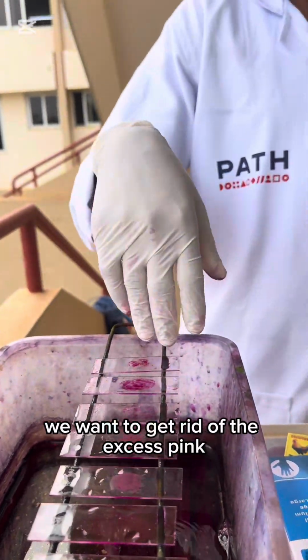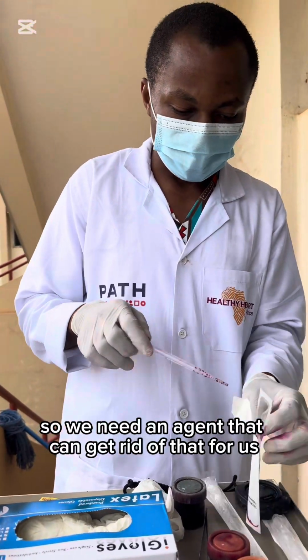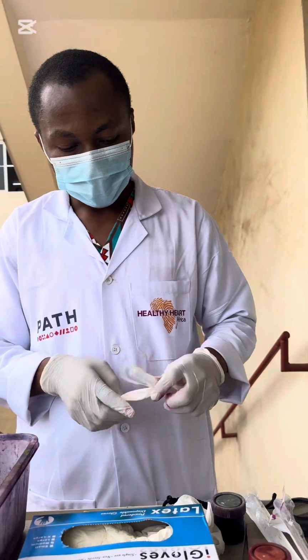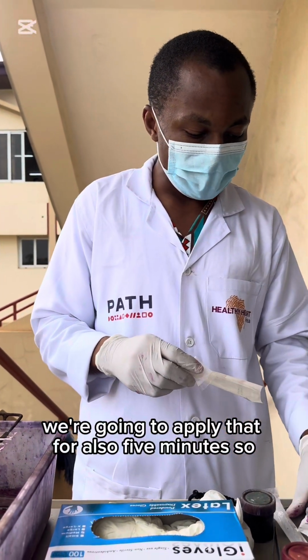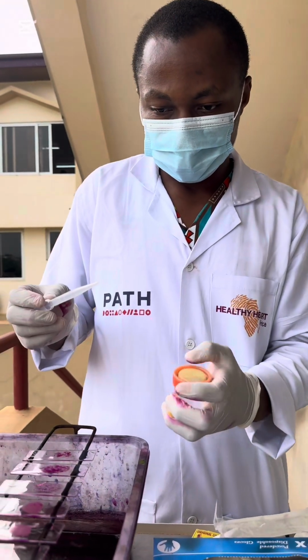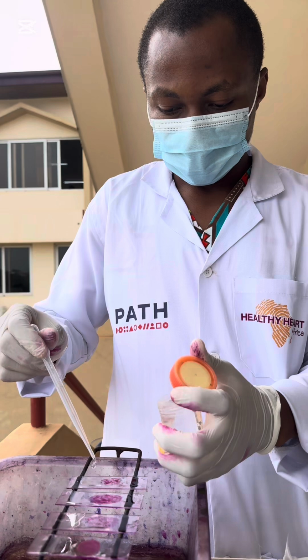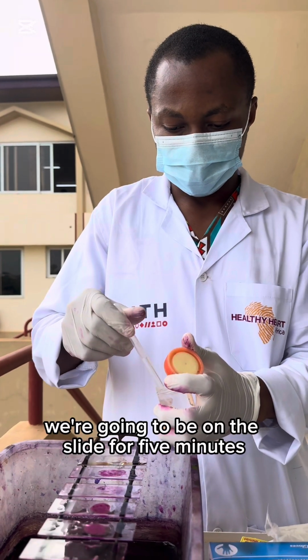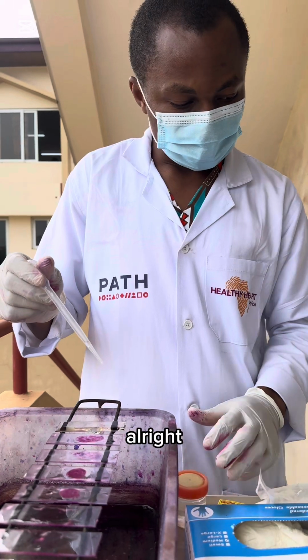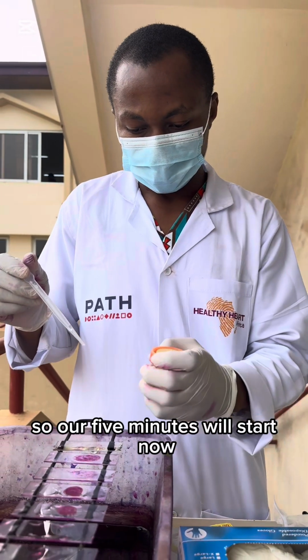We want to get rid of the excess pink. So we need an agent that can get rid of that for us. So we use 20% sulfuric acid as a decolorizer. We're going to apply that also for 5 minutes. So you flood it. It's going to be on the slide for 5 minutes. Right. So our 5 minutes will start now.